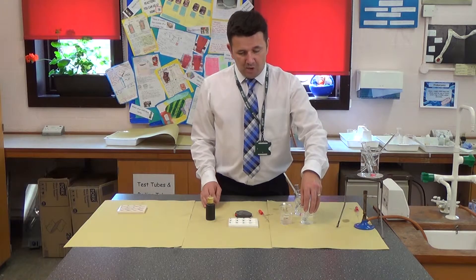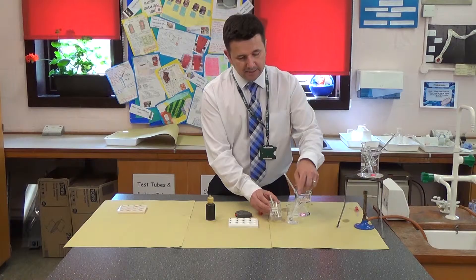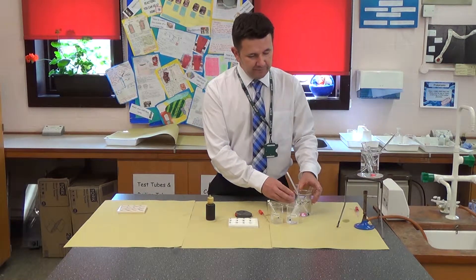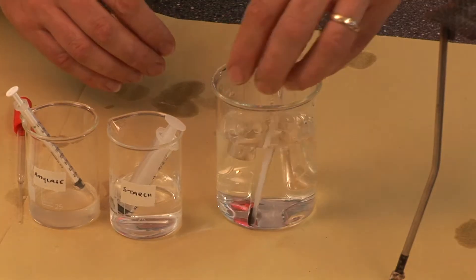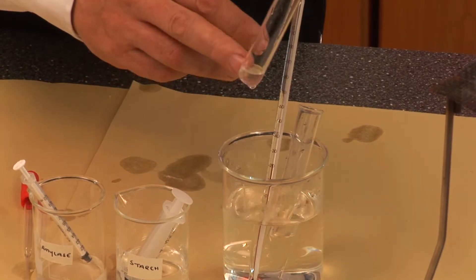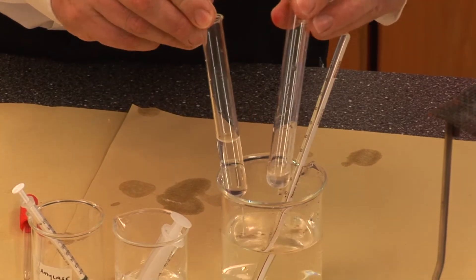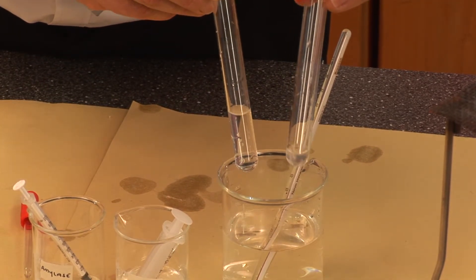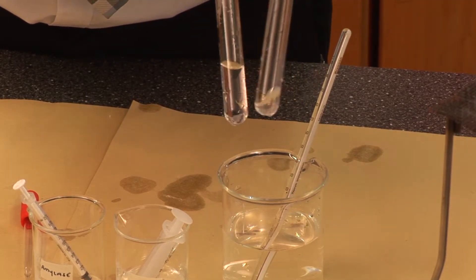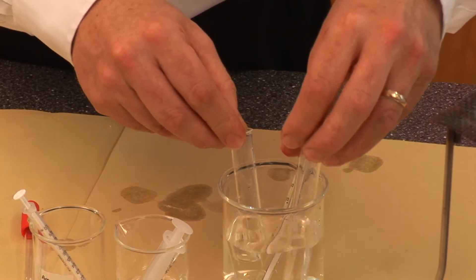I have a sample of amylase and a sample of starch, and I've created a water bath for them. I've added five centimetres cubed of starch in one tube and only one centimetres cubed of amylase. They are in separate tubes so that they can get to the required temperature before I add them together and the amylase starts to break down the starch.